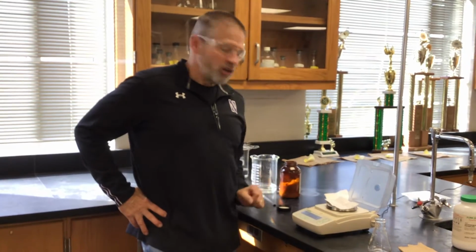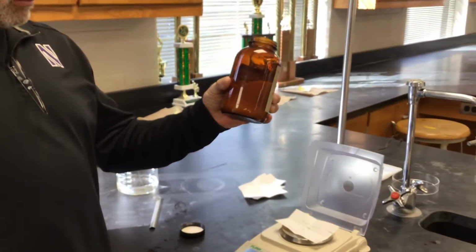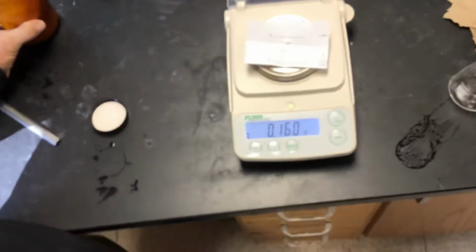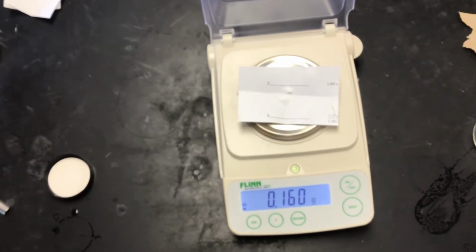So we have an unknown acid. Right, so now here comes the second part of the lab. Right now you're trying to figure out the molar mass of this unknown acid. Okay, it's dry, it's a powder. Okay, and like we did with the KHP, we're going to dissolve it in water and titrate it. So there's our mass of the acid.